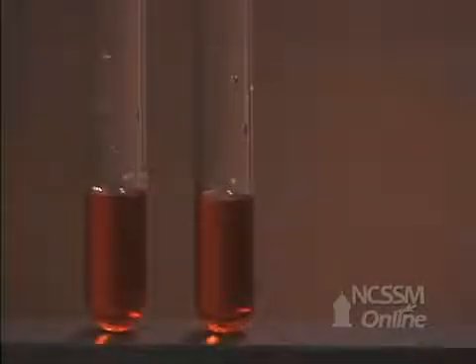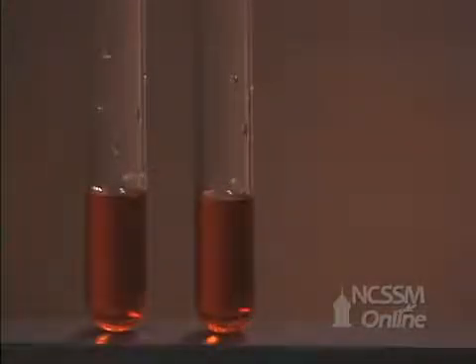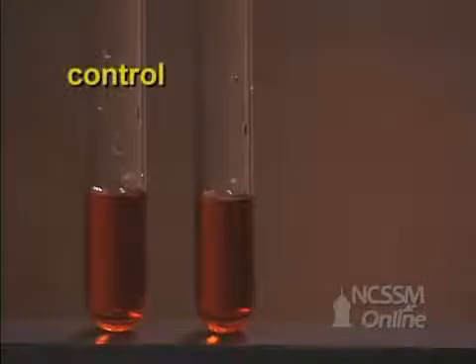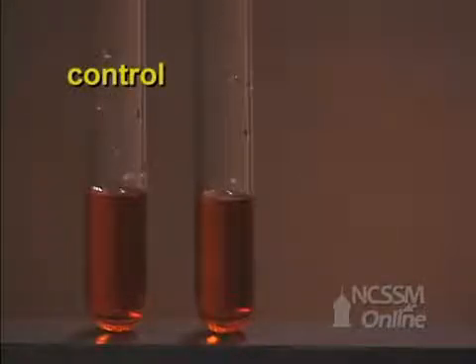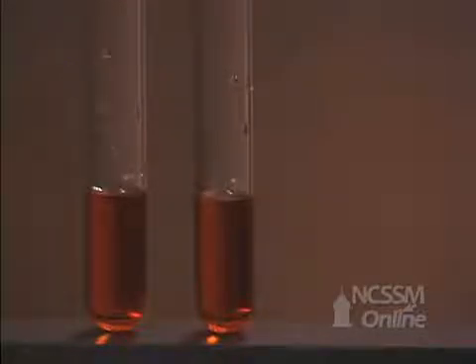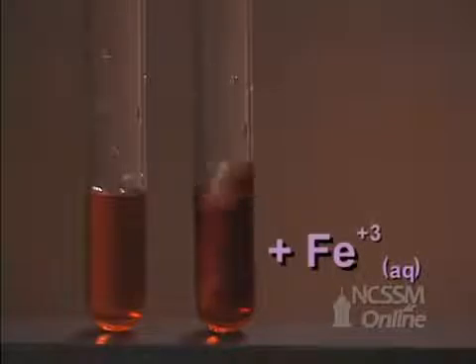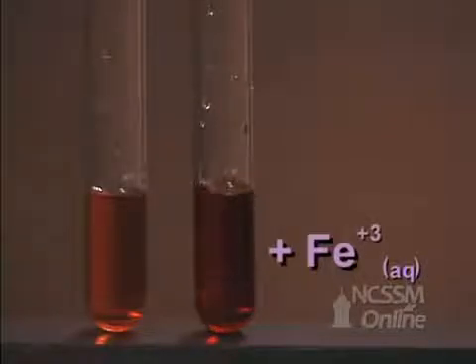We fill two test tubes with the reaction mixture. We're going to keep one test tube as a control so that we can see what happens to the color. To the other tube, we're going to add some 0.1 molar iron nitrate to increase the concentration of the iron.